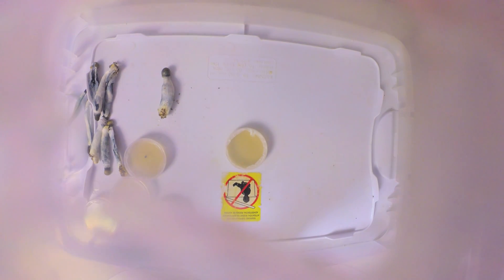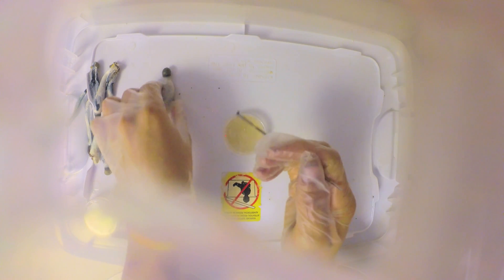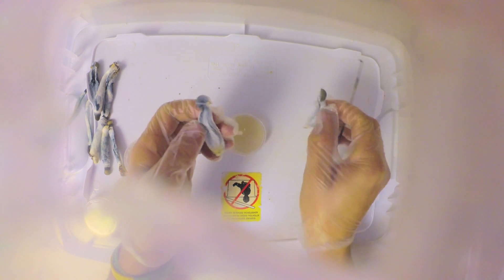Last tray. Cool it down, take a sample, place the sample, and you're done.